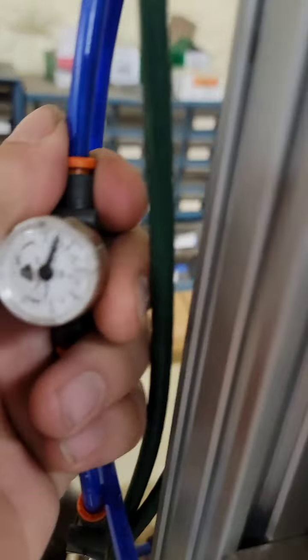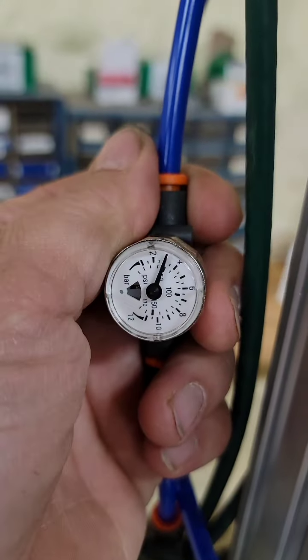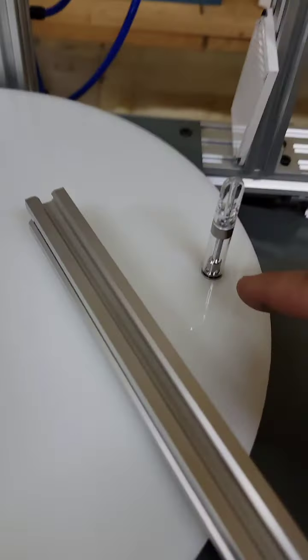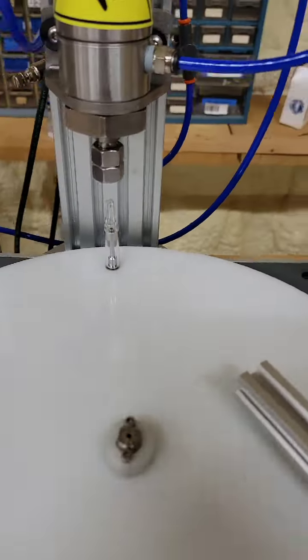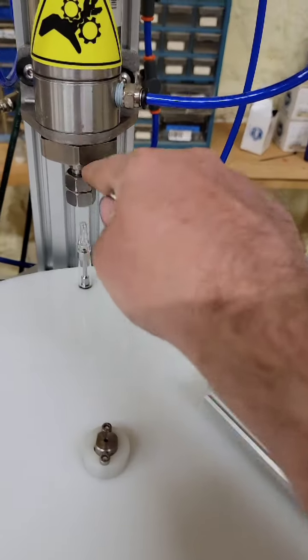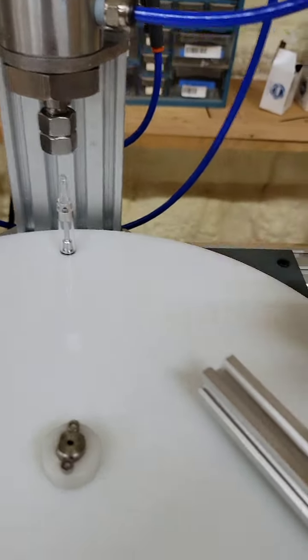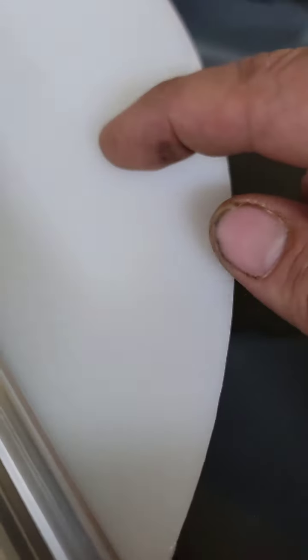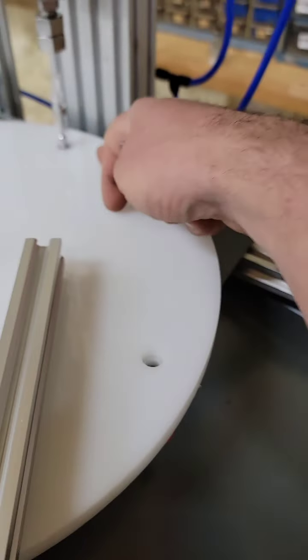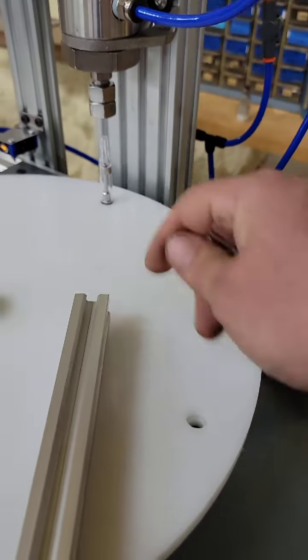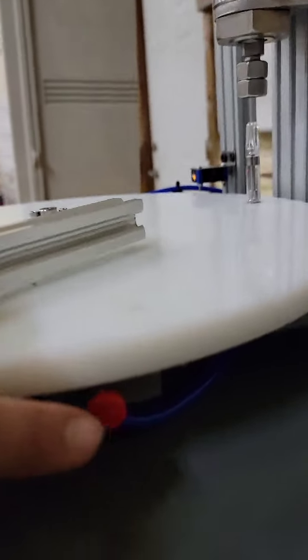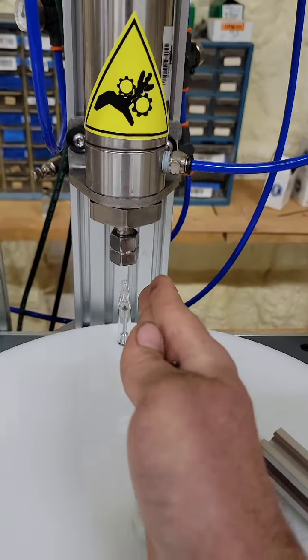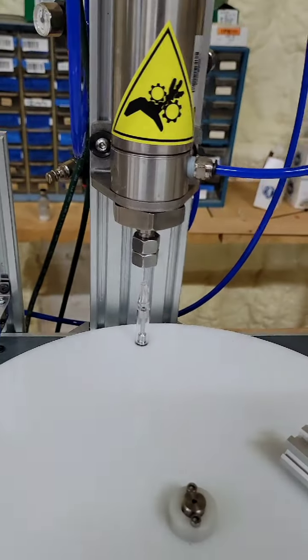As far as ejecting, you can eject it a little higher. Right now, we are at three bar, which works pretty dang good. And ejecting is right here. One thing to note, if you do move this tower too far over to the right, then when this thing ejects, if this guy is capping way over here, this hole is also going to be way over here, which will miss the ejecting side on this side. So, always make sure it's kind of capping counterclockwise from 12, just a little bit.